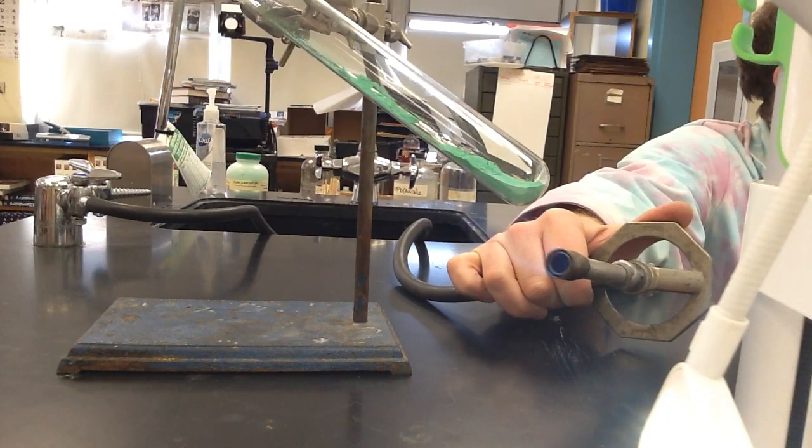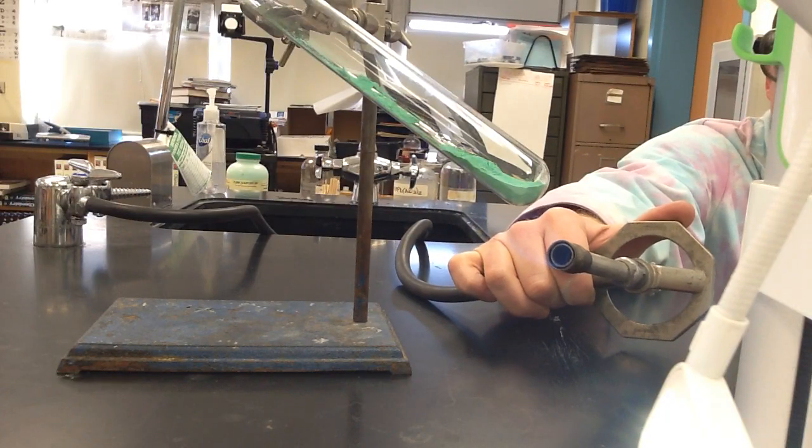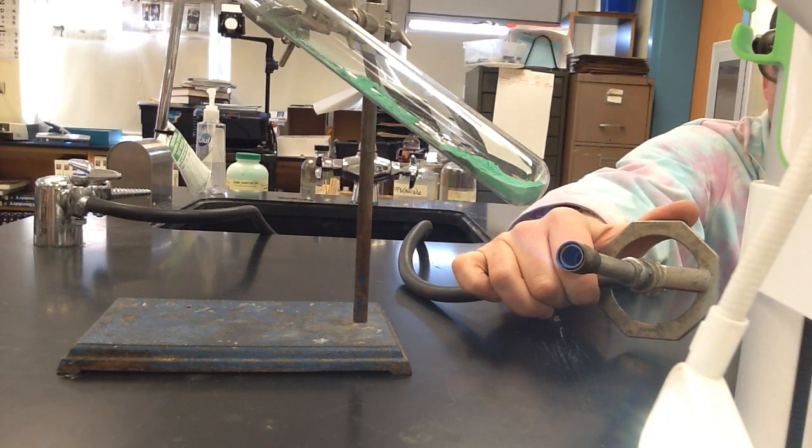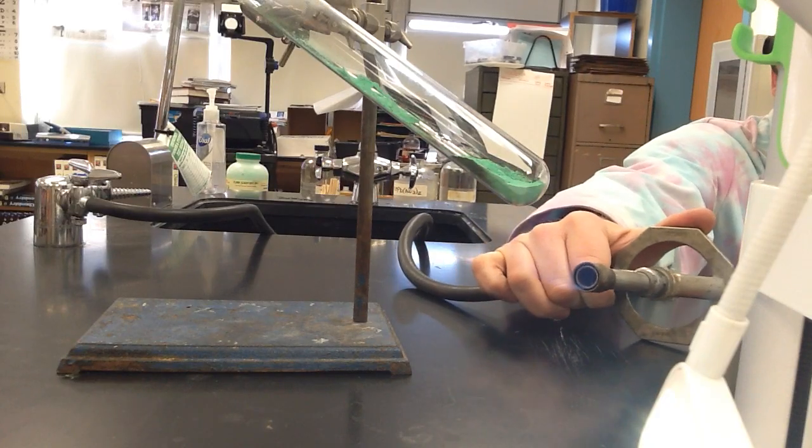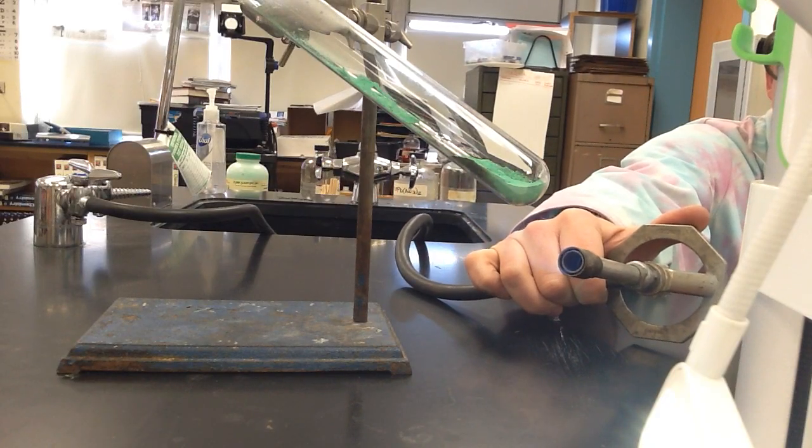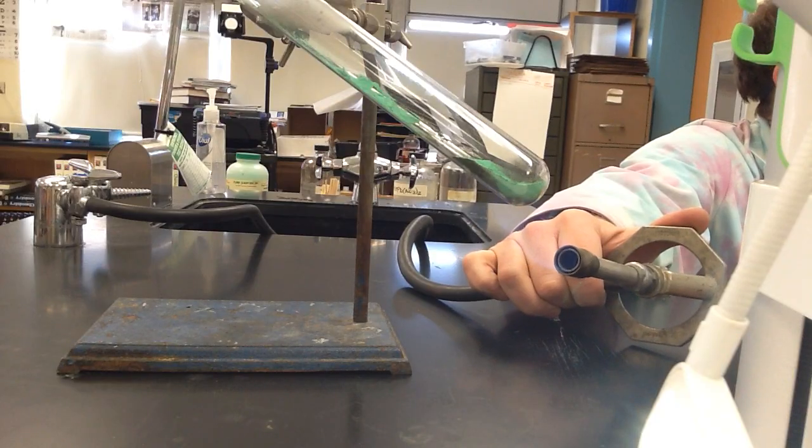Oh, something happened. Yeah, something just like fell. Yeah. What's moving? You see that? See that little puff of powder?